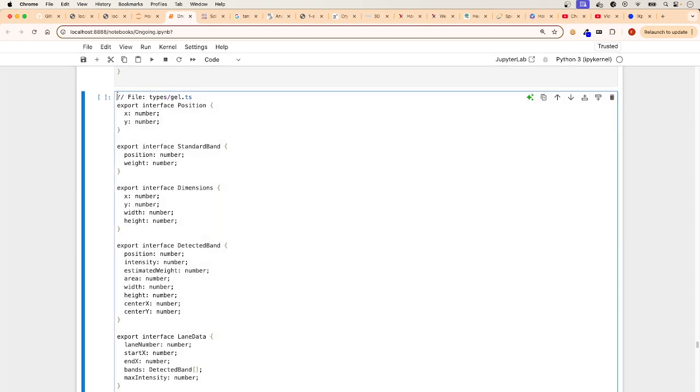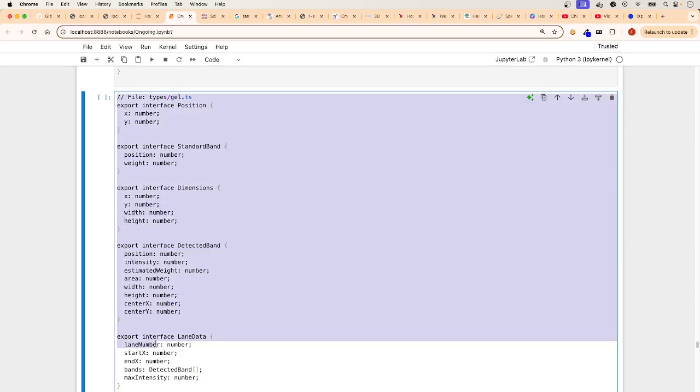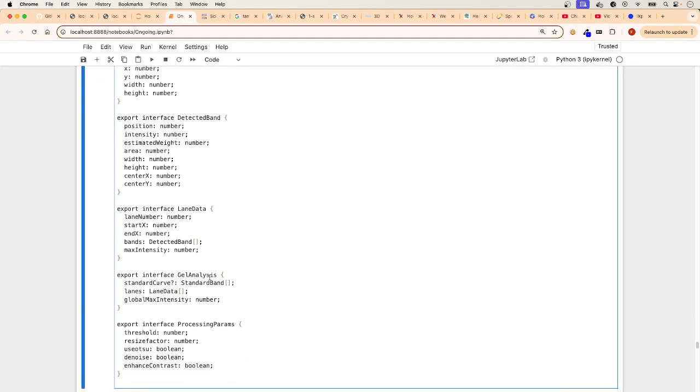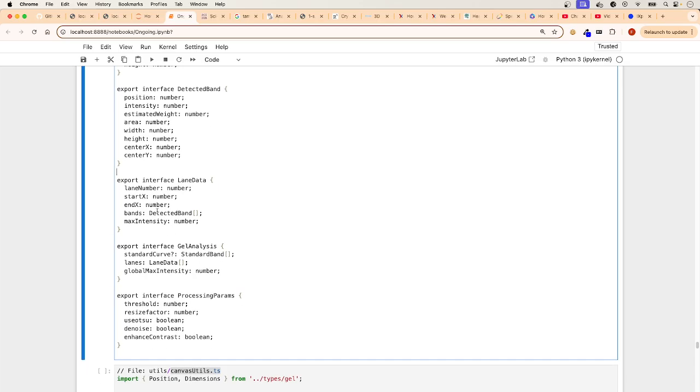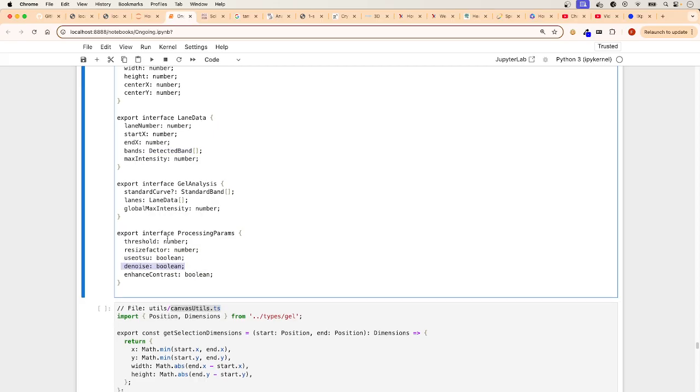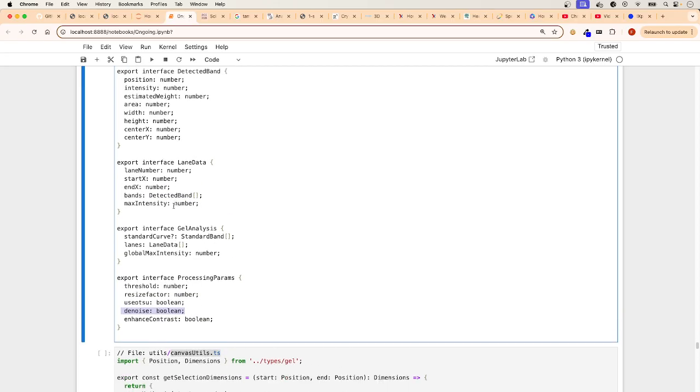This is the types file, with all the types. It's got the detect bands arrays, what is going to be using the booleans, basically making TypeScript happy.